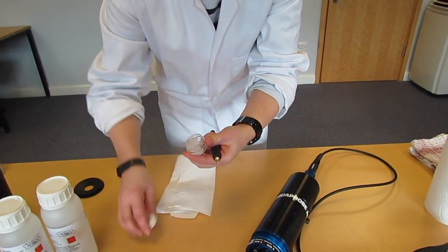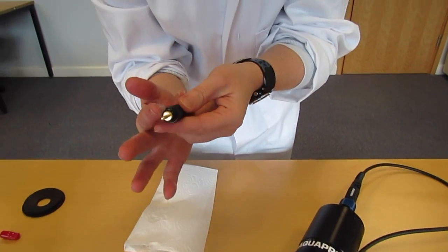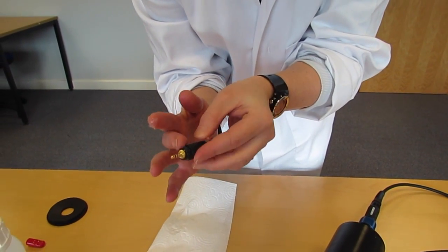Apply the silicone grease to the black threaded part of the electrode, making sure that none goes on the gold connector.